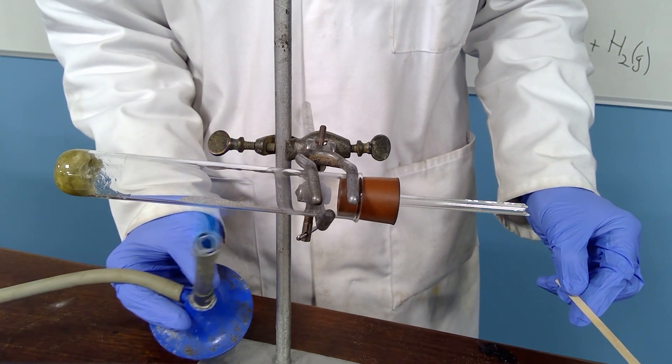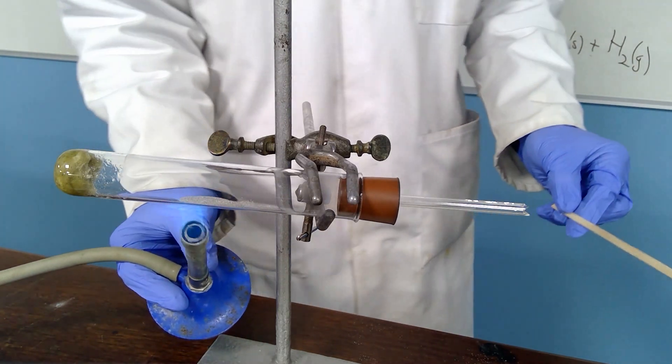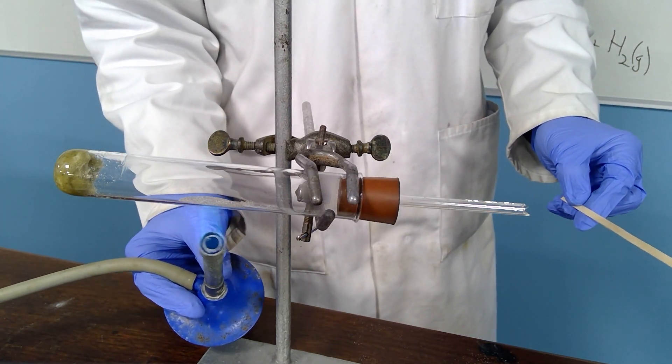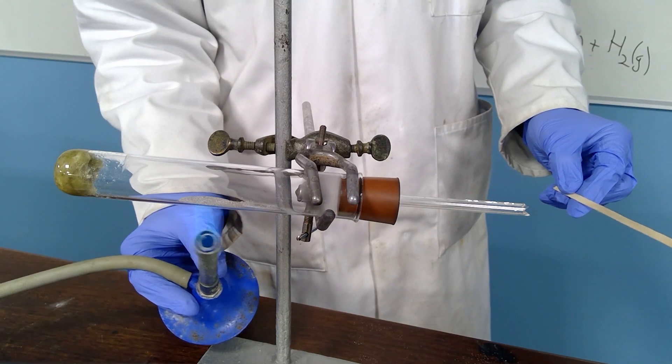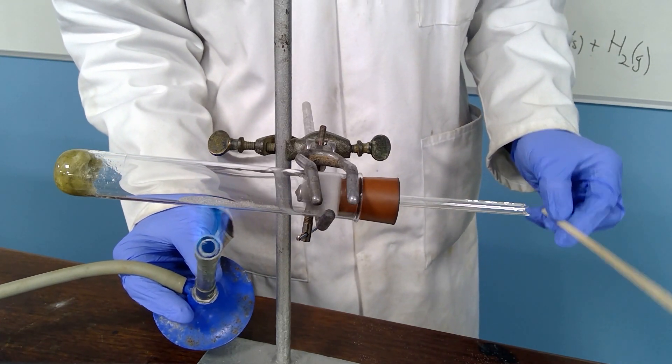Some of the magnesium might start to spark a little as it reacts with oxygen in the air. I'll continue to heat until I see some of that sparking.